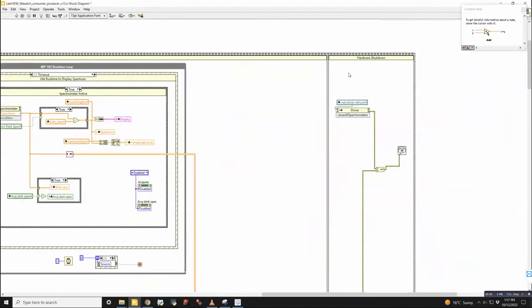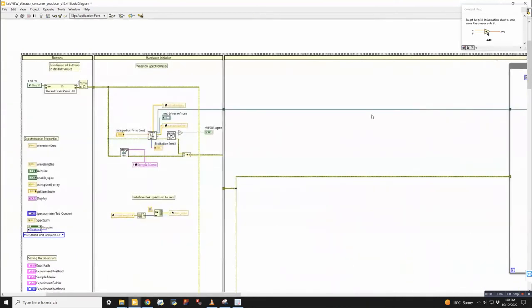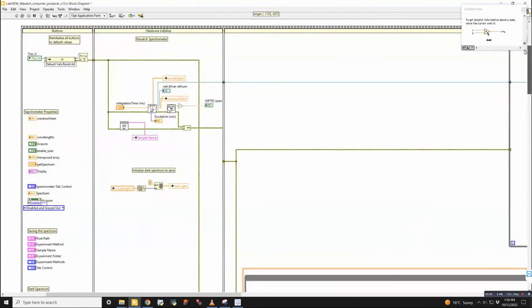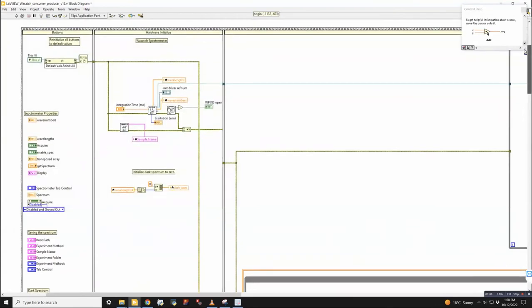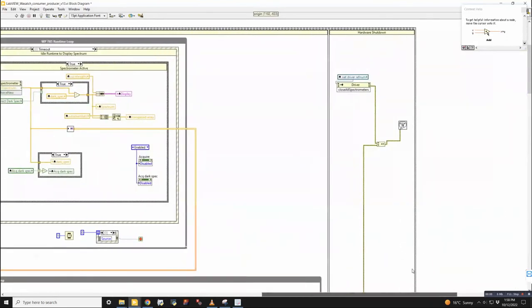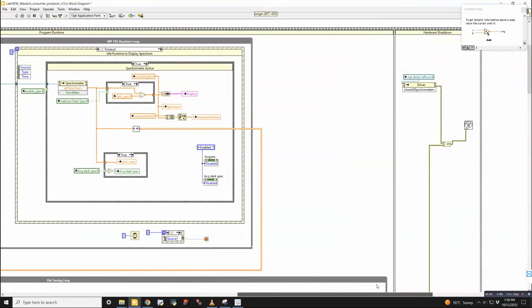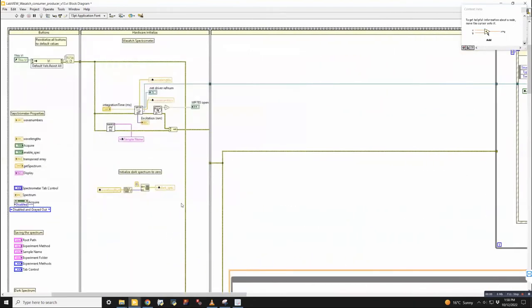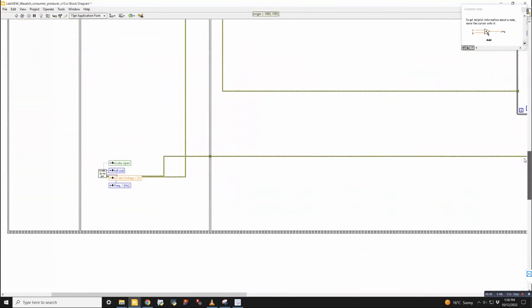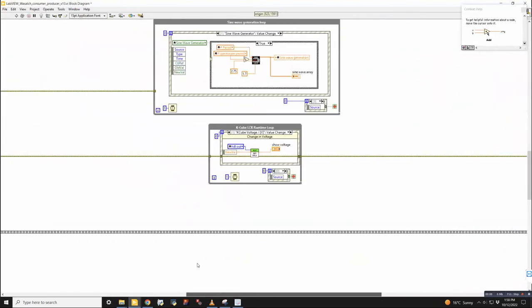It's hardware shutdown. So it's like the first column, just initialize, the second, make the connection with the hardware pieces, the third is the user inputs and variables, and the last one is shut everything down. Yep. And it always works that way. So I will show the very most basic way to connect to these. I think the K-Cube probably has the simplest connection here.